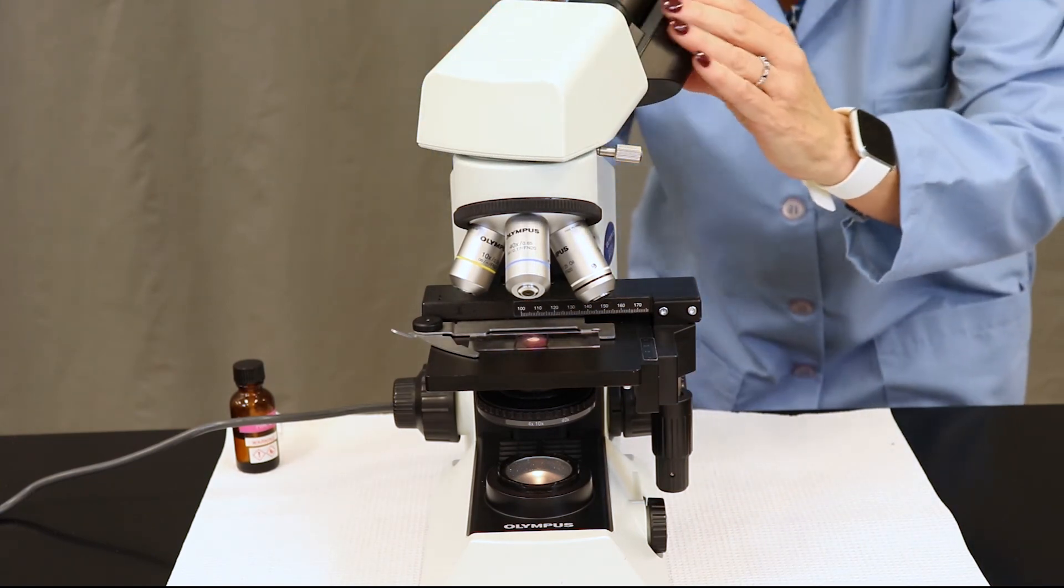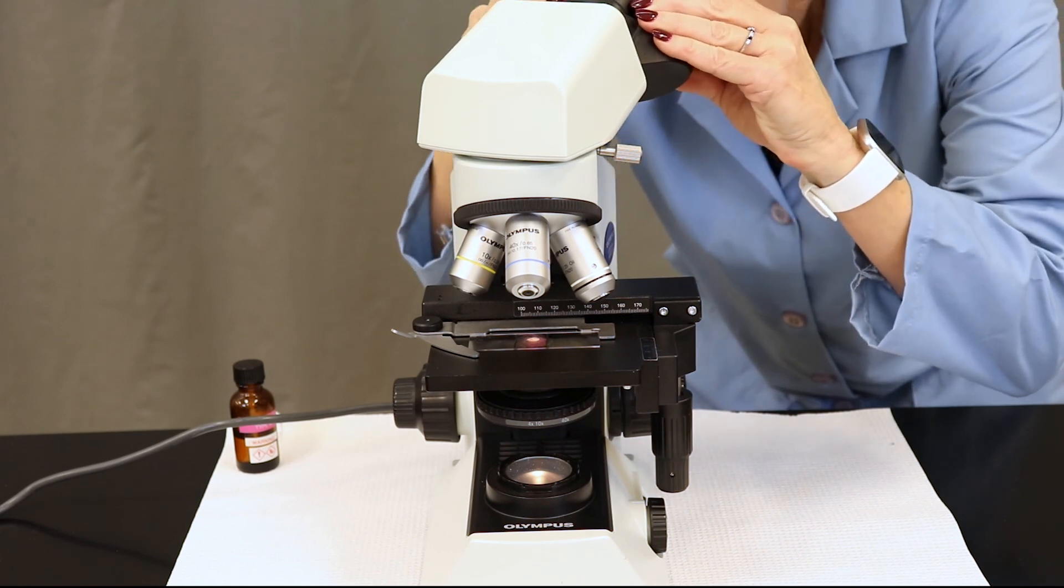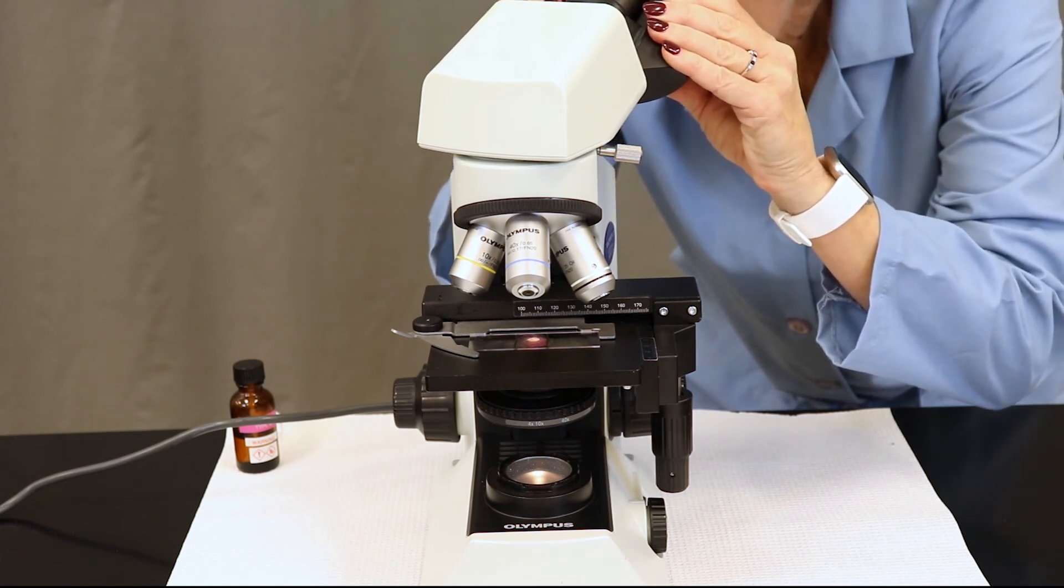You're going to rotate the ocular lens and adjust to your particular eye width.